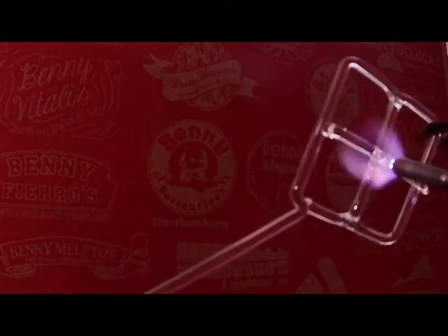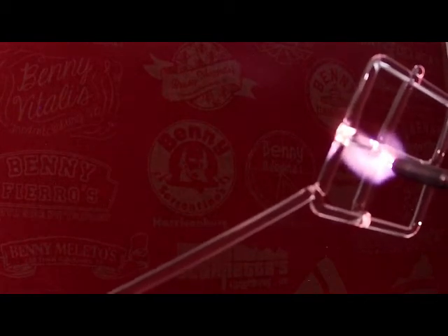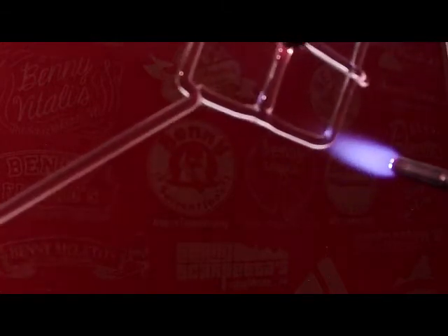Now what I'm going to do is I'm going to focus on these two rods in the center and essentially start pushing them closer and closer to each other to get them to touch. Actually, here, I'll take the tweezers and squeeze that down. There we go. There are lots of different ways you could do this. I could take another piece of glass rod and put a little blob of glass between the two. That would essentially tack weld them together. I could take my graphite rod and push on it as I'm in the flame, but I'm just gonna stick with the tweezers and do that, mush them together.